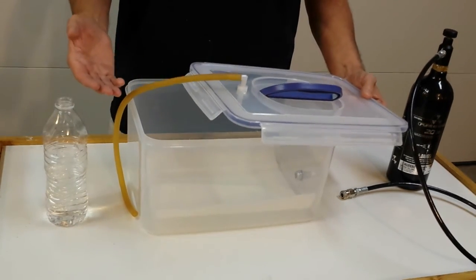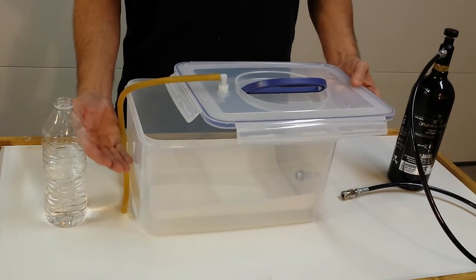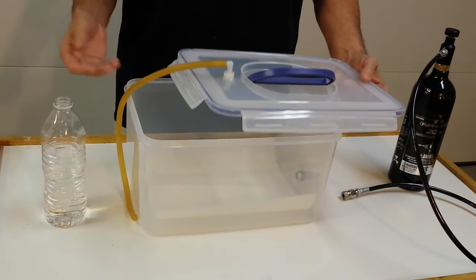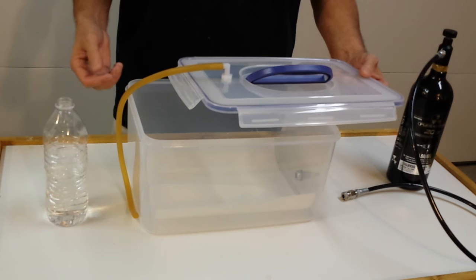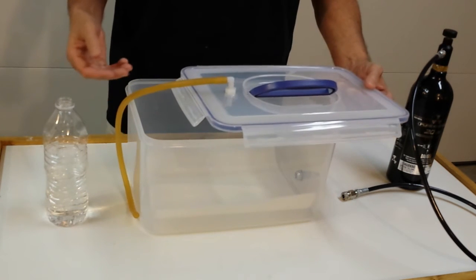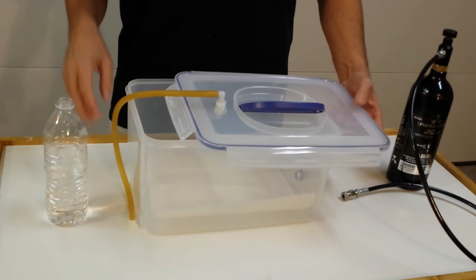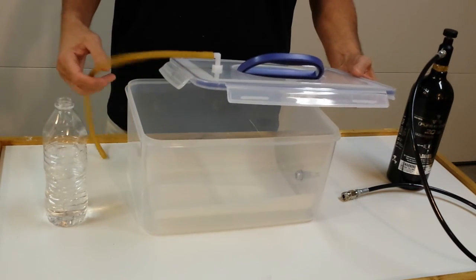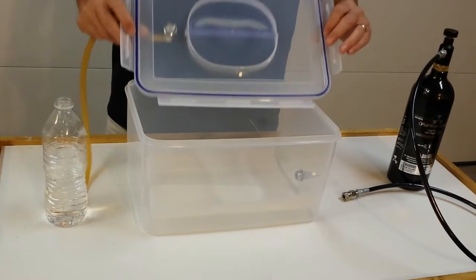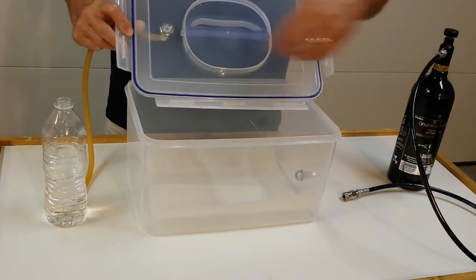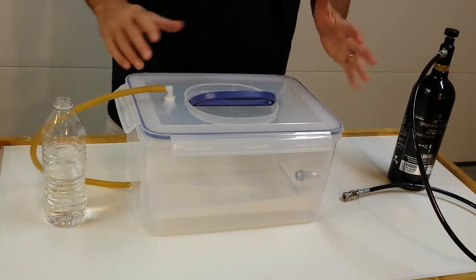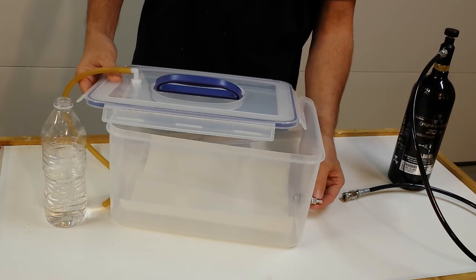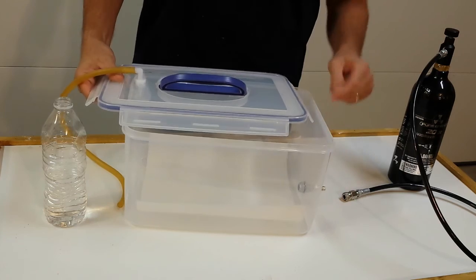Carbon dioxide is heavier than oxygen, so it will settle down in the bottom. And I have noticed that during changes of different batches, the CO2 remains in the chamber and the rats will start to kind of fall asleep even without even turning the gas on. So it does kind of stay in there. So this, I'm not sure whether you really need it or not. I chose to continue to use it. The container I used, like I showed you before, has a seal around it - silicone seal, locking lid, just to keep it all airtight.